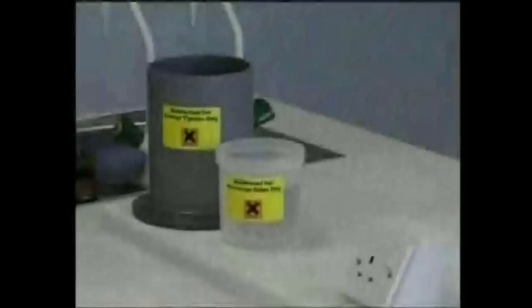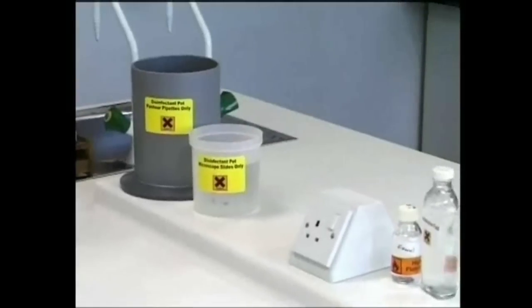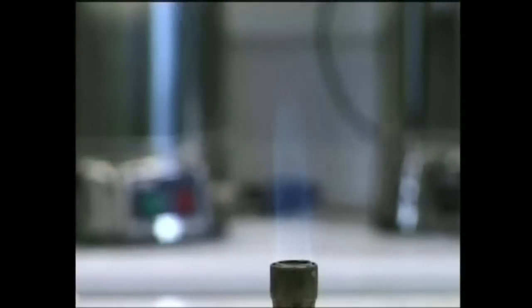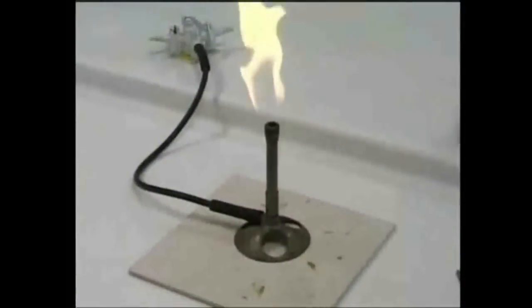Only essential items should be taken to the workbench. Anything else should be left outside the lab or away from the bench. You'll need a Bunsen burner. For work with microorganisms, use a roaring flame. Return the flame to yellow when you're not using the Bunsen. It's easier to see the yellow flame and therefore safer.